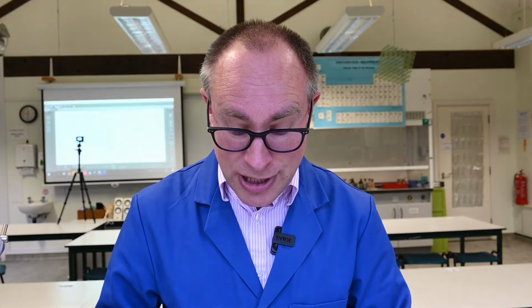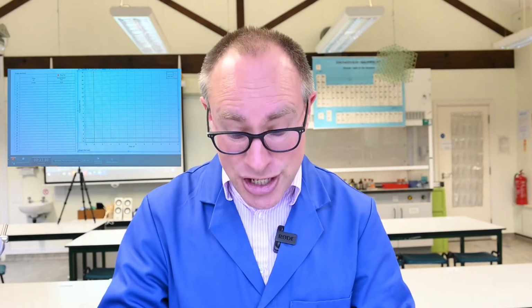Okay, so I'm going to place the temperature probe into the solution, into the copper sulfate. I'll just let that sit for a moment or two to reach the temperature of the solution, and I'm going to start recording. So I've set this up to take a measurement every minute, so I'm going to collect a temperature reading at 0 minutes, at 1 minute, 2 minutes, and 3 minutes. At the 4th minute, I'm not going to take a reading. Instead, I'm going to add the zinc and stir, and then I'll record a temperature every minute from the 5th minute through till about 10 minutes.